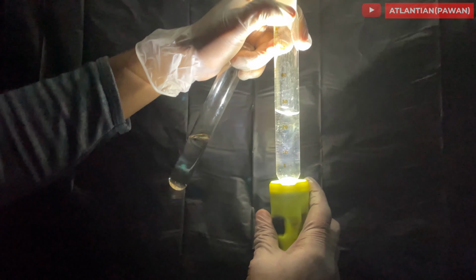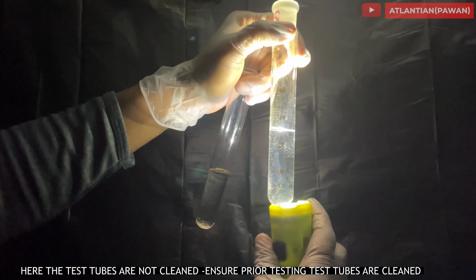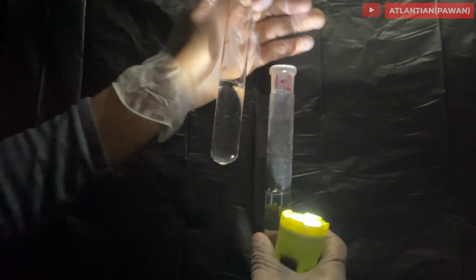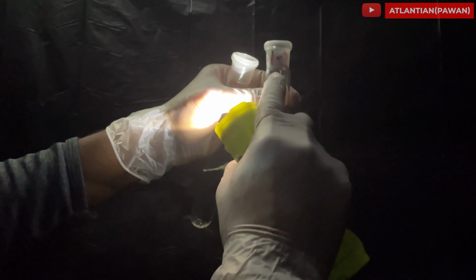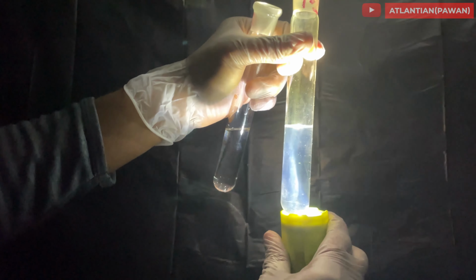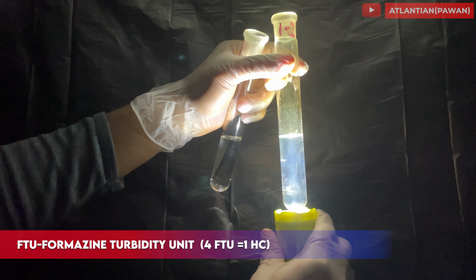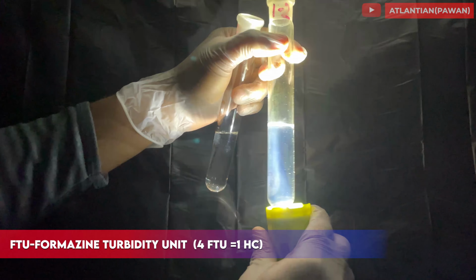So in this example you can see the glass which I am holding, that is the reference sample with 0 hydrocarbon, and this is the tank sample where I have hydrocarbon of 1 to 2 FTU. So normally the hydrocarbon test is either pass or fail, but if you want to measure it in units, then it will be formazine turbidity unit, that is FTU.